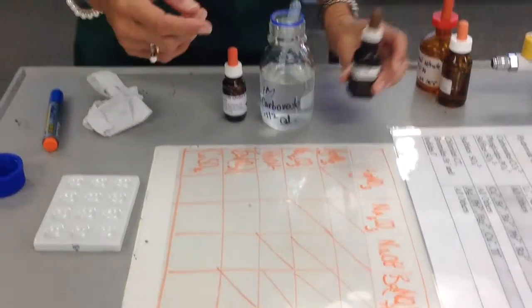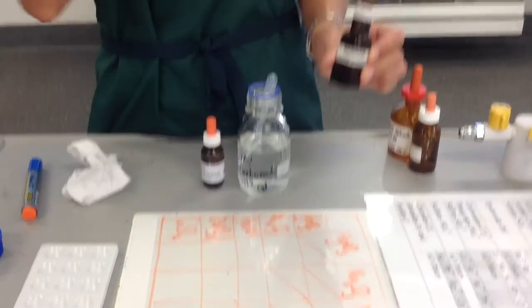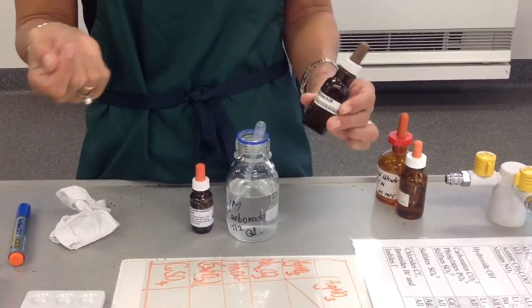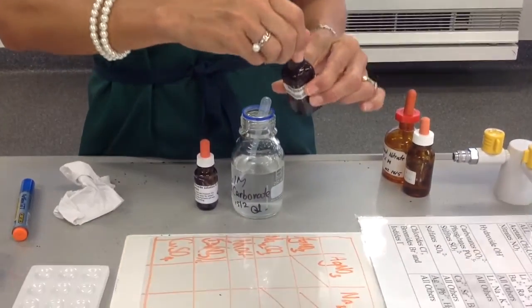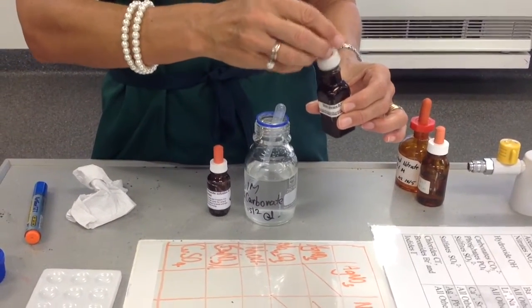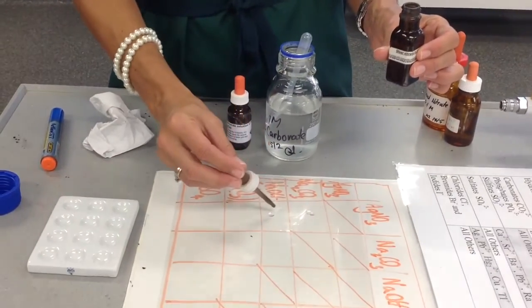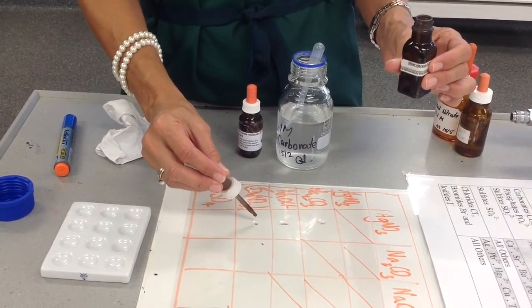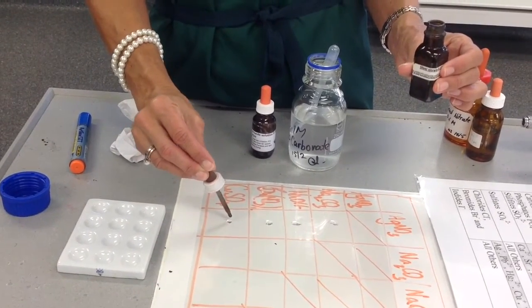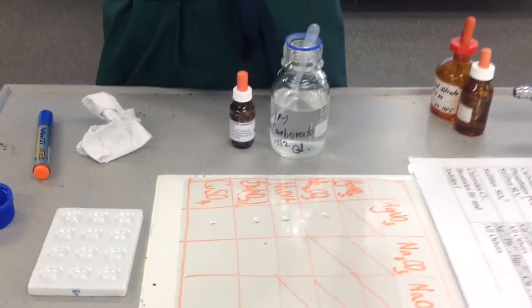So what I'm going to do for the first example is take some silver nitrate. Silver nitrate is very dangerous. You don't want to get it on your skin because it turns black. It reacts with light. So your teacher will come around and put the drops of silver nitrate on. So what I'll do, in my silver nitrate column, is I just simply put a couple of drops down the group, and that's prepared now for the other reactants.